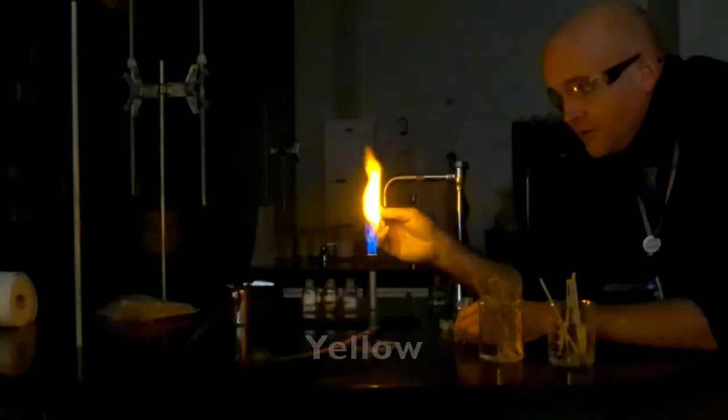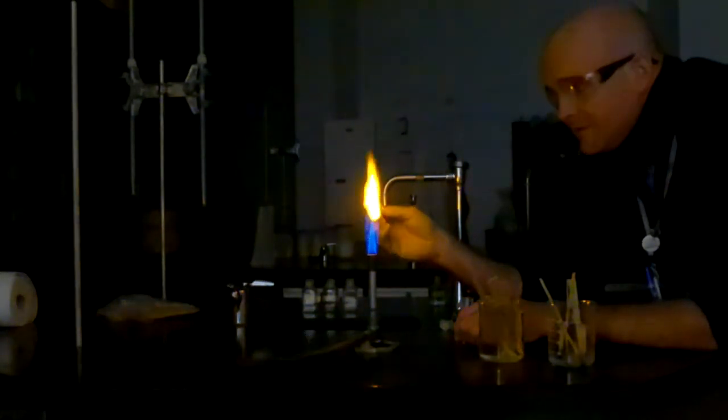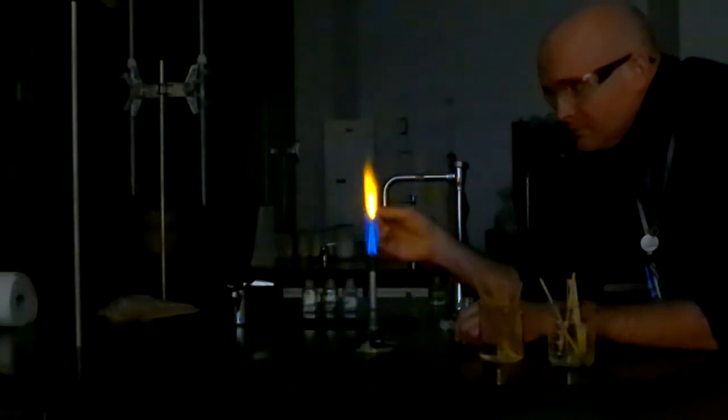Yes, sodium chloride. So this one's different. This is not sodium nitrate. This is sodium chloride. So we're going to see later on, we're going to compare sodium chloride and sodium nitrate together. Just give me a second and let's see that. Ooh. So this is everyday salt. Salt looks like this when you burn it. Don't try this at home.